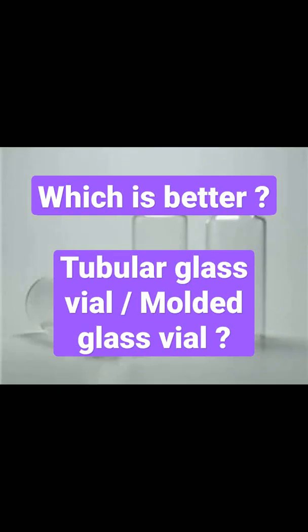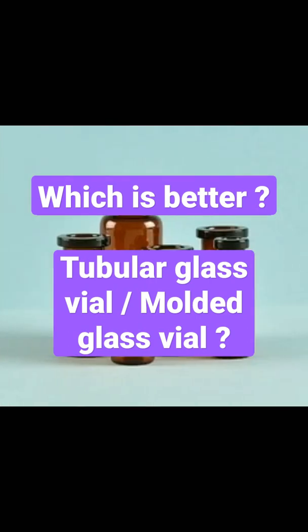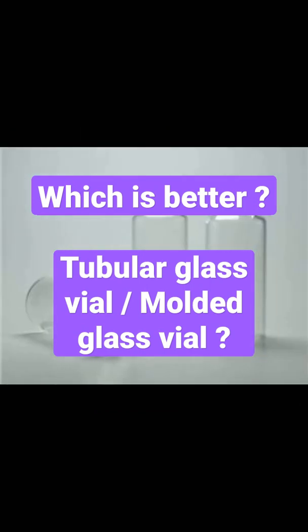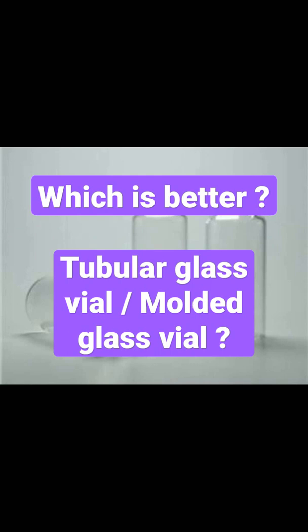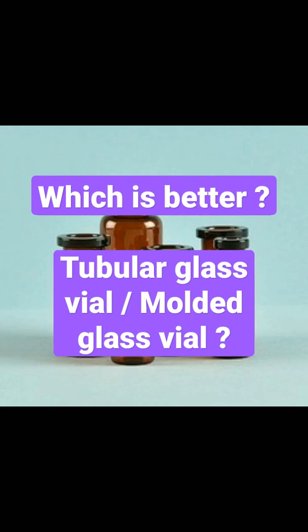Due to a less easily controlled manufacturing process, molded glass vials have a less uniform wall thickness and uneven surface. If you are planning to freeze dry or terminally sterilize product within the vial, tubular glass vials are better suited to the process as they provide more consistent heat transfer as a result of a thinner and flatter base.